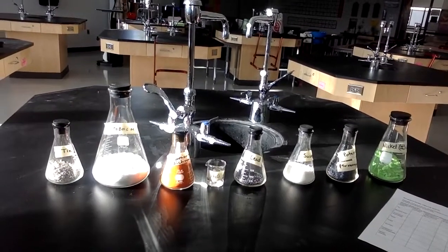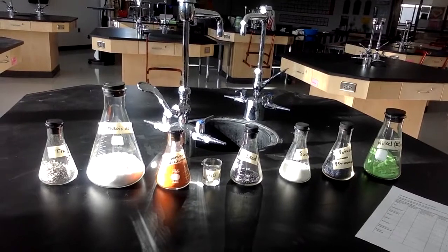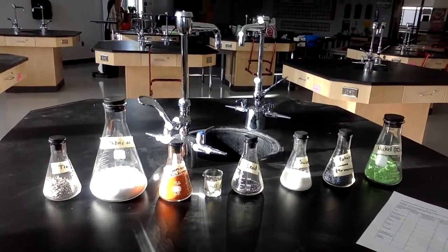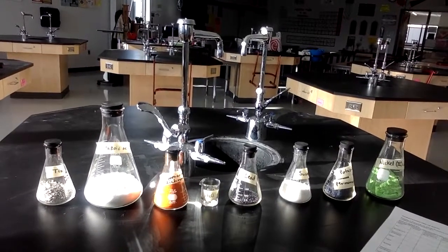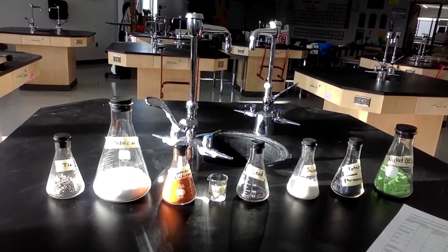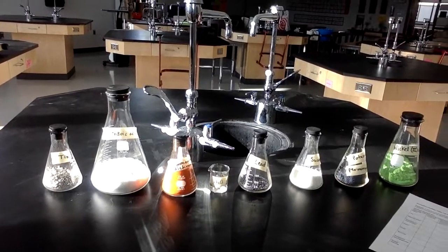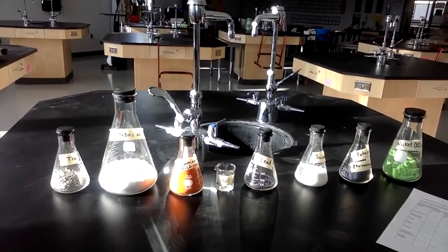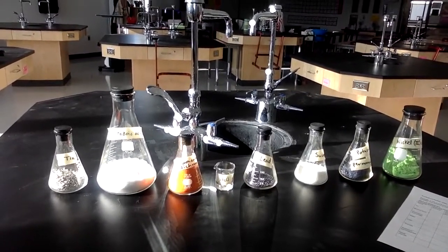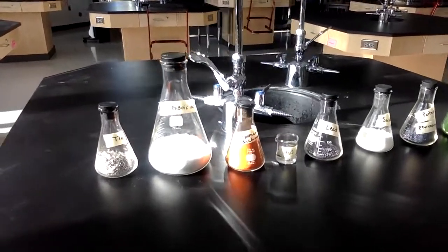Seeing that some containers are really small, some containers are much bigger. Some samples are much smaller, some samples are much bigger. But what I want you to realize is that all of these samples are 1 mole. So now you've got a visual of what this word mole looks like. And all of these samples are 6.02 times 10 to the 23rd particles. It's just that some of those particles are called atoms, some are called formula units, and some are called molecules.